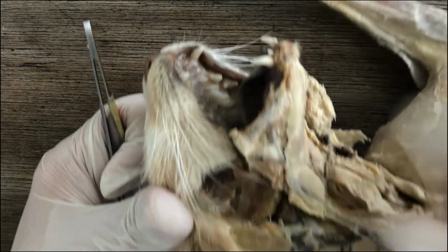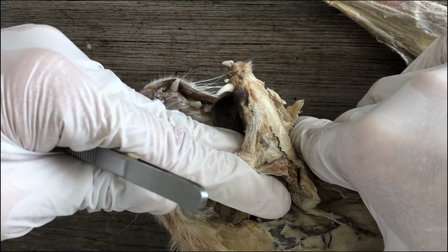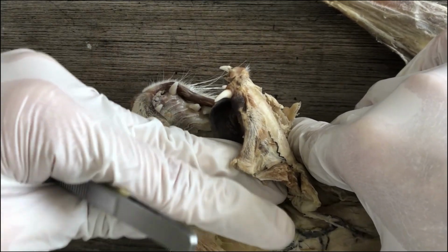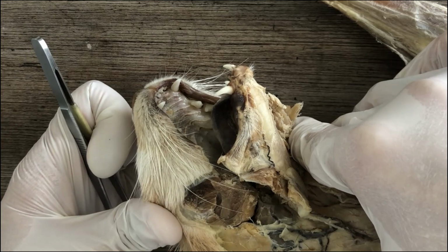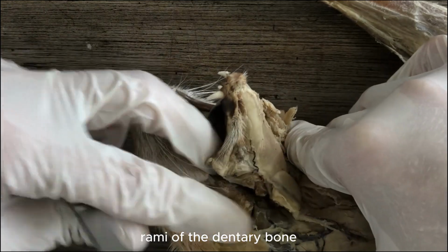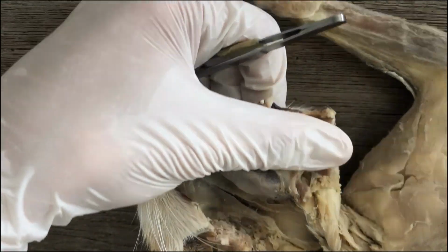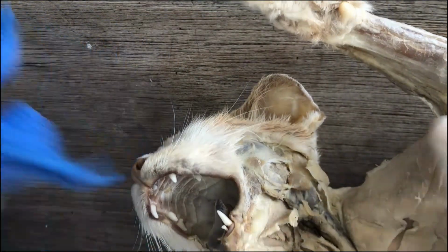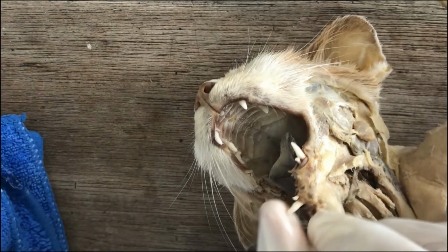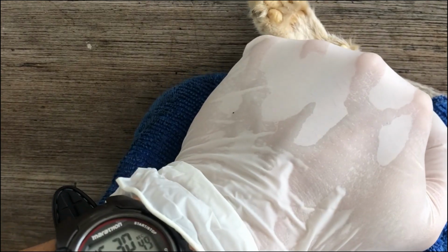You use the bone cutter we have here, and essentially cut one of the rami of the mandible, break it, and then you push it like so with the help of some rags or cloth so you don't get injured by the teeth. And then with the help of a cloth, you push the mandible like that.